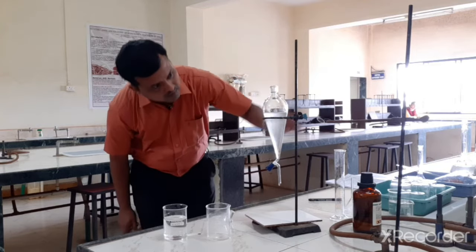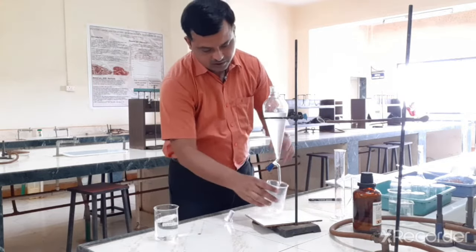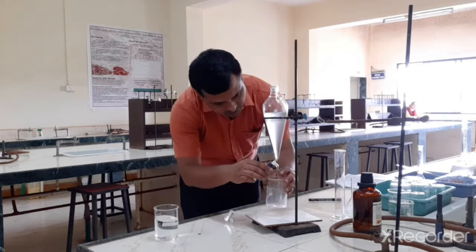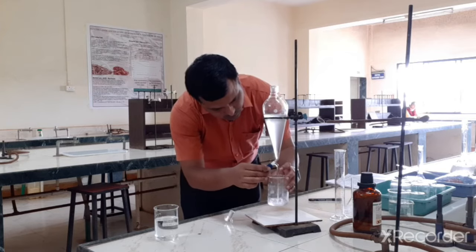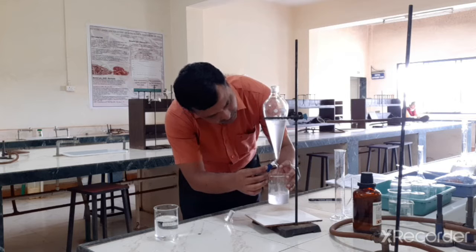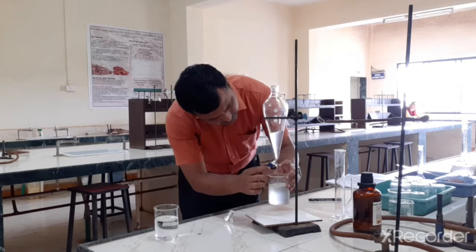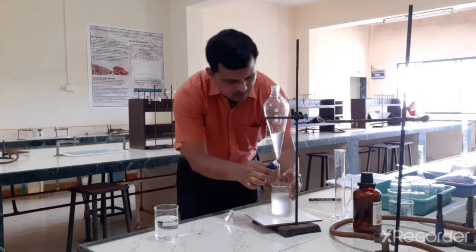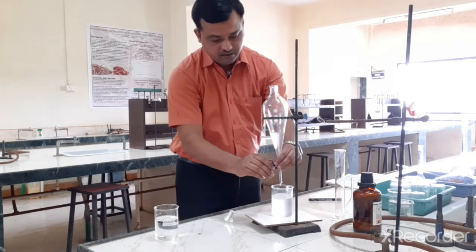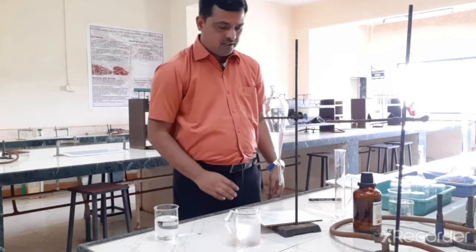Okay, so I am going to take here this bottom layer, that is chloroform, from which we are separating our trimethoprim. Okay, so this is the first batch of extraction with aqueous acidic pH.